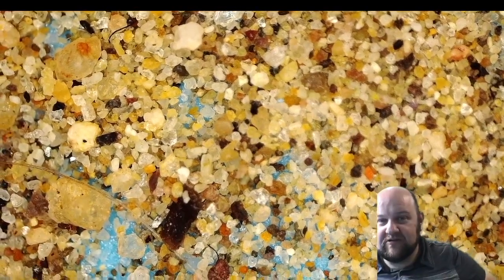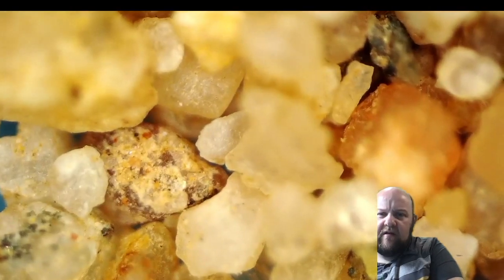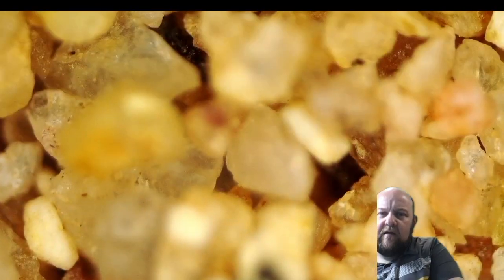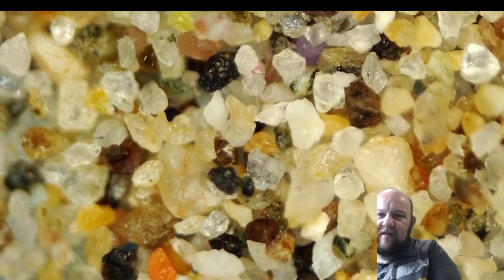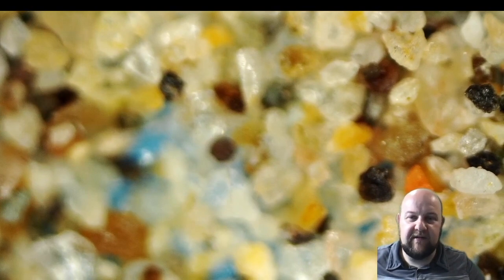But yeah, this is the beach. This is the playground. And let's go close up 200 times zoom on the playground sand. And yeah, that's 200 times zoom on the playground sand, and 200 times zoom on the beach sand. Sorry, I'm like not keeping myself centered here.